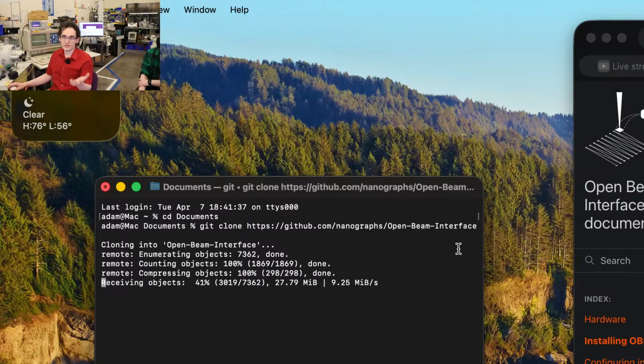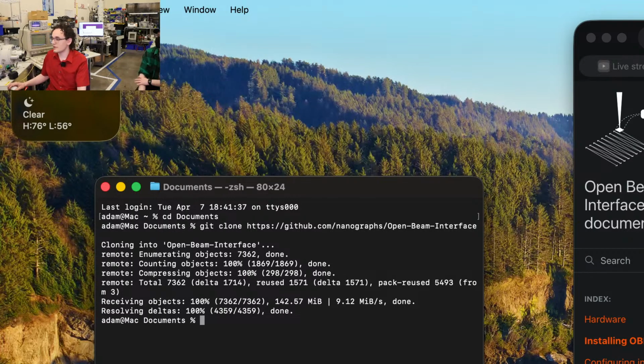The prerequisites for this that we haven't shown yet are that you need Python installed. Today we're on 3.13, I think is what we left on this computer. Yeah, I think so. And then you also need to get PDM installed, and to do PDM, you need Homebrew. Homebrew takes a little bit, so we did that before because we didn't want to wait for that initial install. PDM also does the Python environment, because macOS comes with an older version of Python, and PDM sets up the correct version of Python that we need.